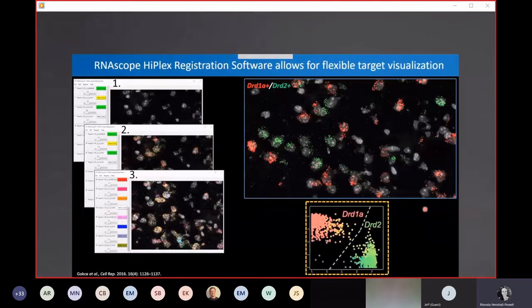With the HiPlex registration software, you're registering images from your various rounds of HiPlex probe detection onto one another, but this also allows you to visualize these targets in a flexible manner. You can toggle on and off different channels. So for instance, if you just want to look at 2 genes together, DRD1A and DRD2, for example, you can do that. And here, what's kind of cool is, canonically, you think of DRD1A and DRD2 being mutually exclusive, but it was previously reported in the literature that there are cells that express both of these markers. And just looking at this HiPlex data in this panel here, you can see these 3 cells that are expressing both green dots and red dots, corresponding with co-expression of both of these markers.